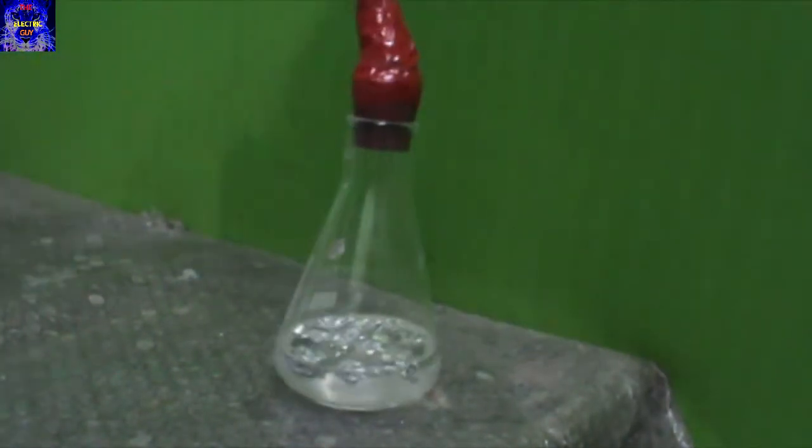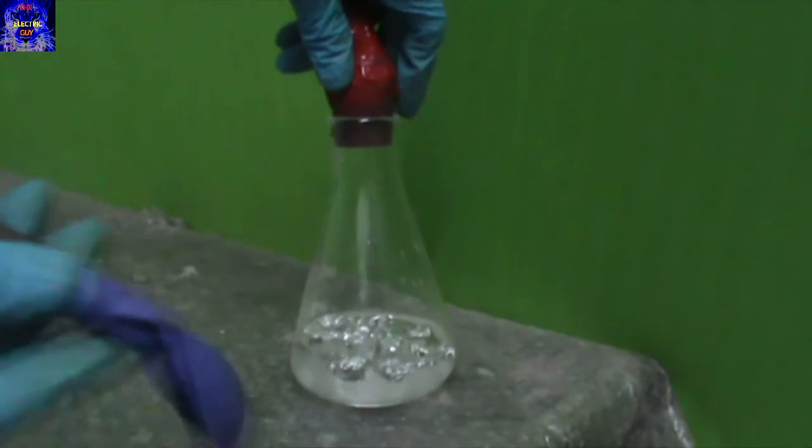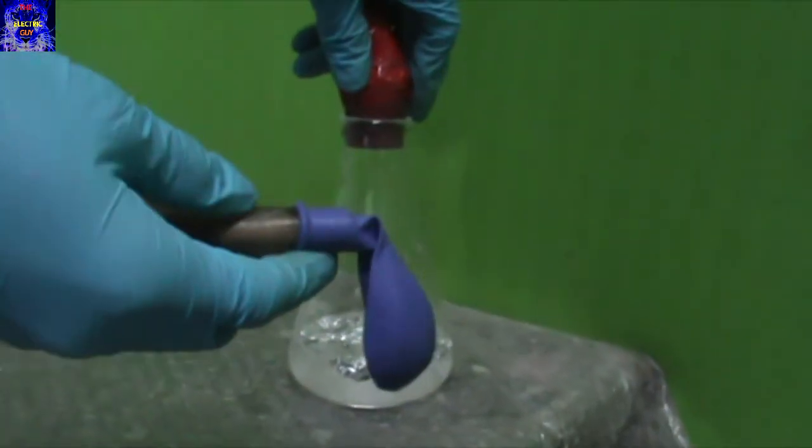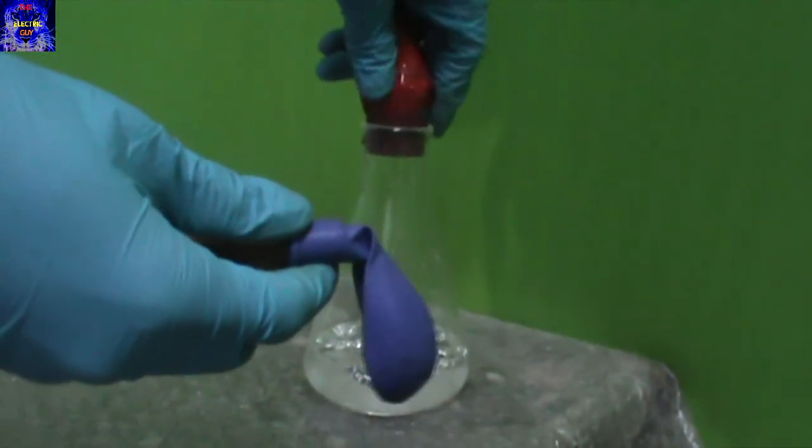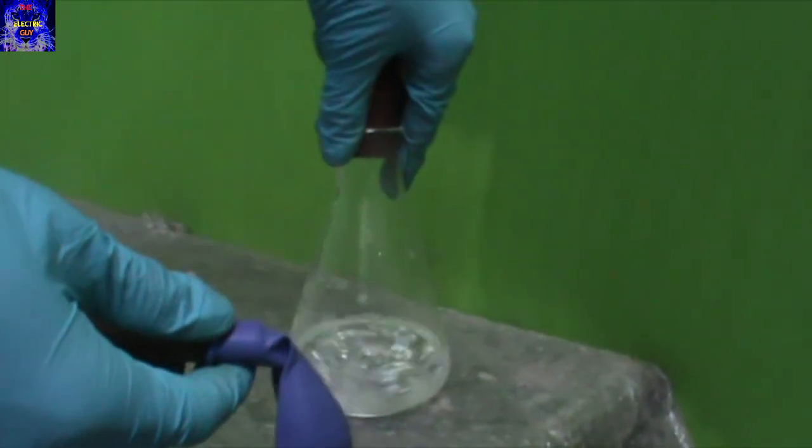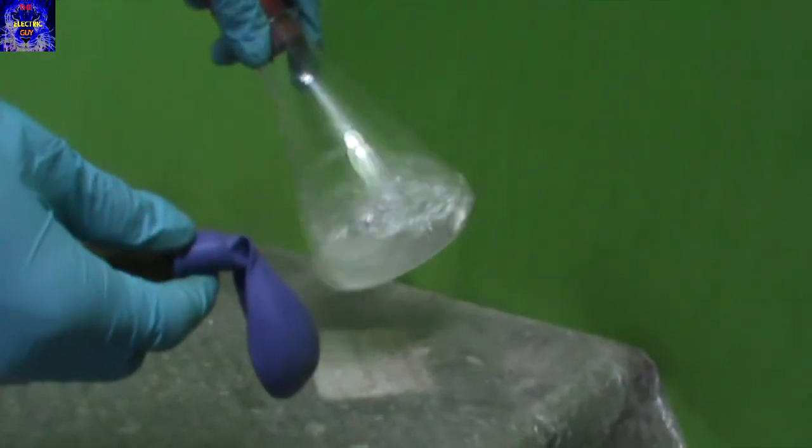Water will get mixed with sodium hydroxide pellets and react with aluminum, which will produce hydrogen gas. The hydrogen gas will be stored in the balloon.